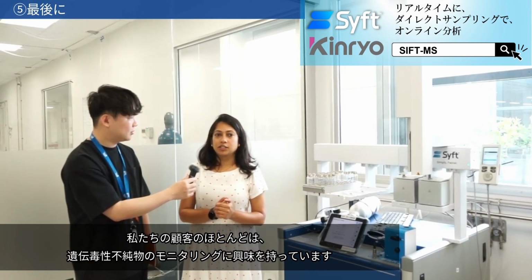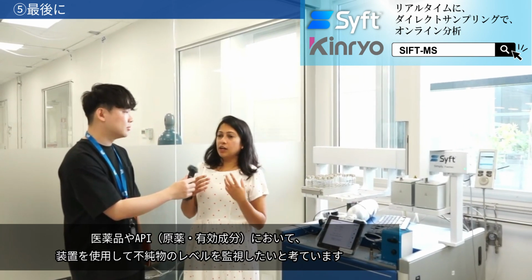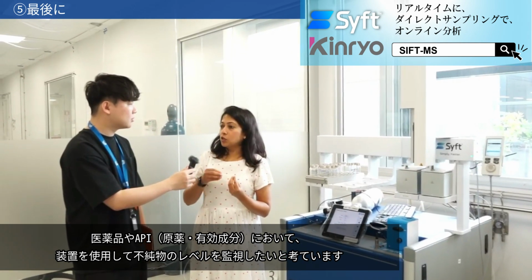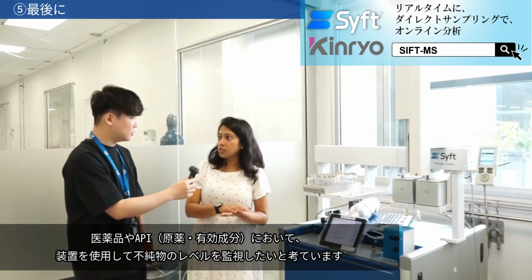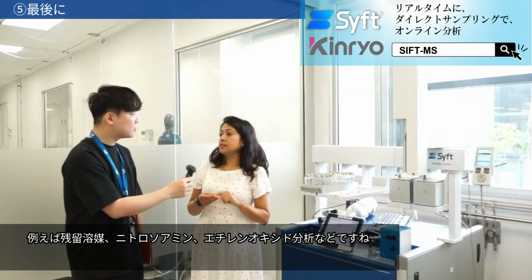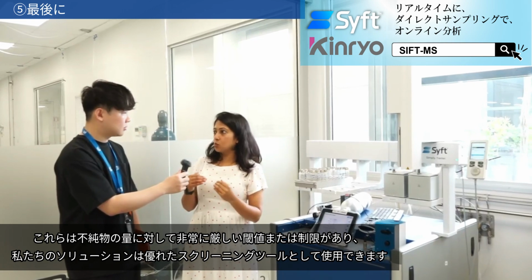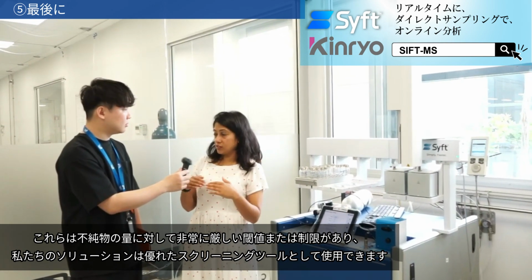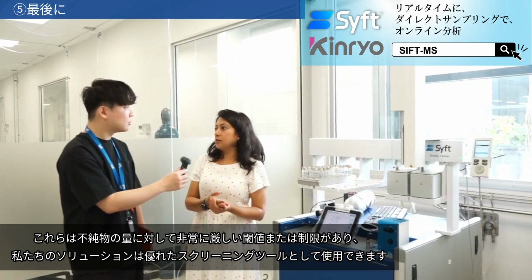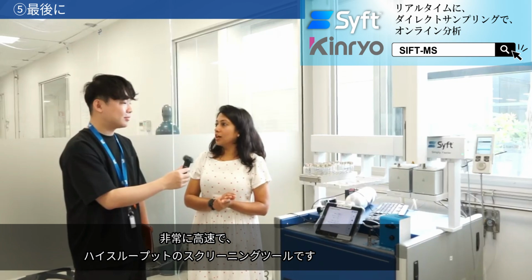So most of our customers are interested in monitoring genotoxic impurities. So these pharmaceutical drug products or APIs, they want to monitor the level of impurities using our product. So things like residual solvents, nitrosamines, ethylene oxide analysis. There's a very strict threshold or limit for the amount of these impurities that can be present. And our solution can be used as a good screening tool, a really fast, high throughput screening tool.